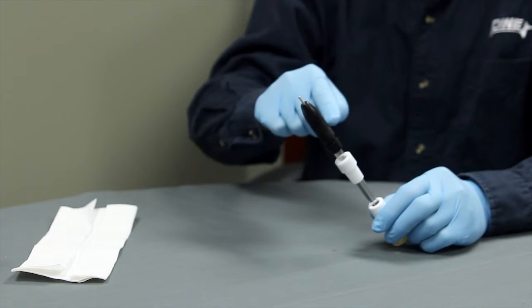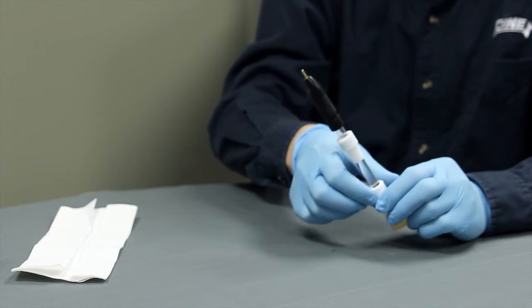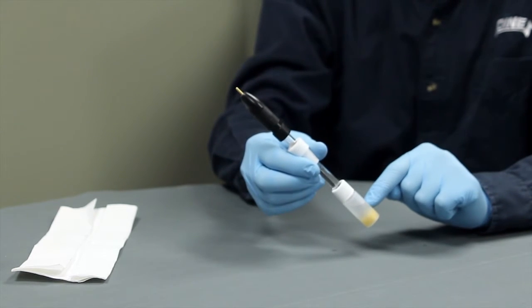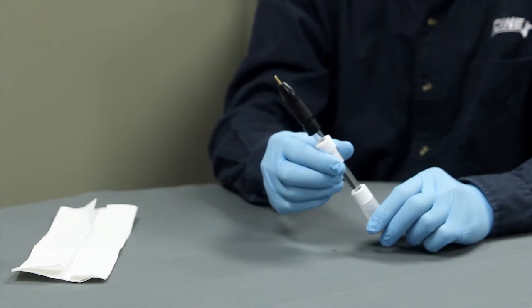Unpacking the electrode is simple. First, you'll remove the parafilm. Check to make sure the tip is wetted. If it is, the electrode is ready to use.